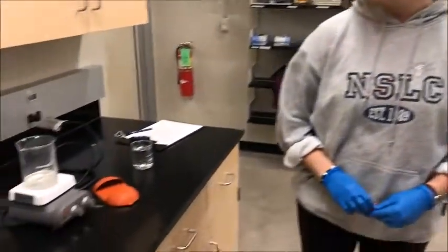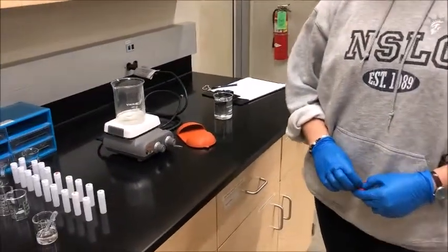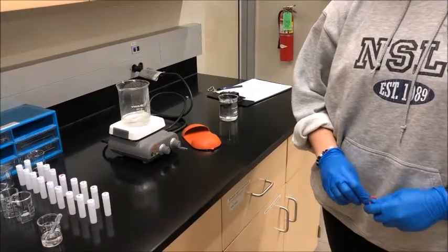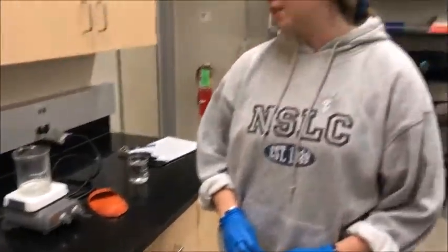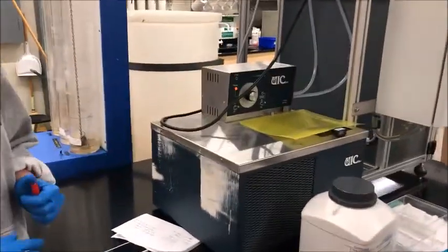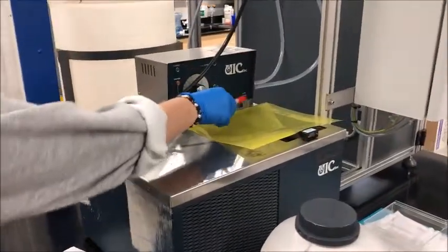Heat some water for use later in the lab. To do this, add a beaker to a hot plate and a magnetic stirrer as well as some water. Turn on the hot plate as well as the magnetic stirrer. We do this when we're adding water to solutions, and we use hot water in order to not fracture the glass of our apparatus. Afterwards, turn on the cooling bath to 20 degrees Celsius and make sure that the flow control is open.